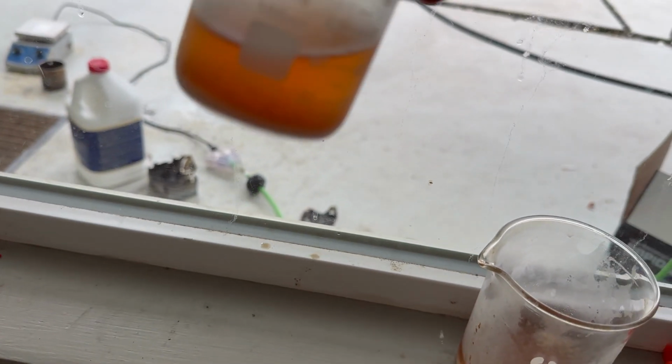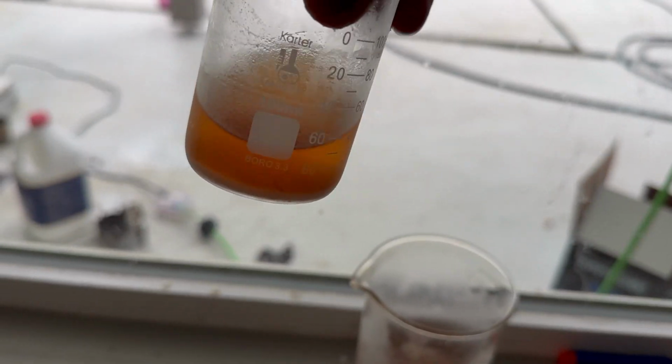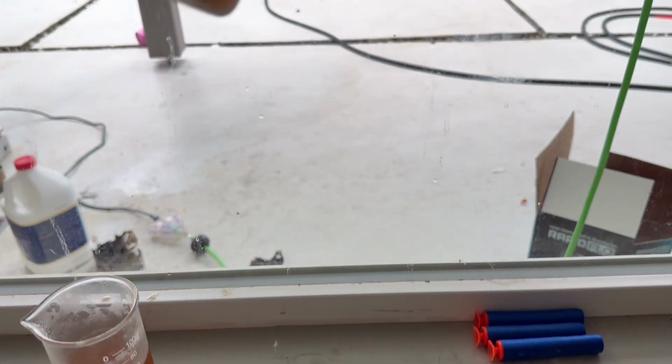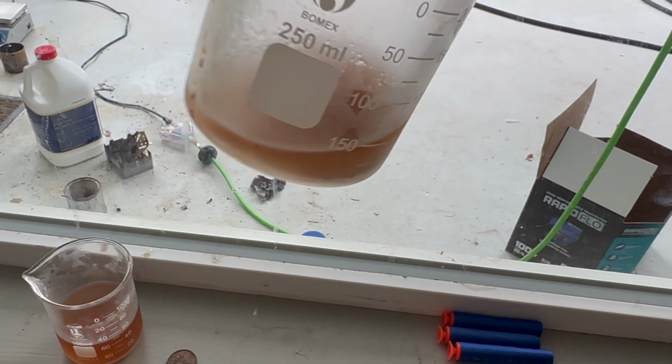Holy crap. Alright, see this? This is one I made previously. It's in a smaller beaker. You can see there's a decent amount of crystals. This is the one I made. To get the focus right. Look at the amount of crystals here. Look at how much crystals are in here. Look at it. It's amazing.